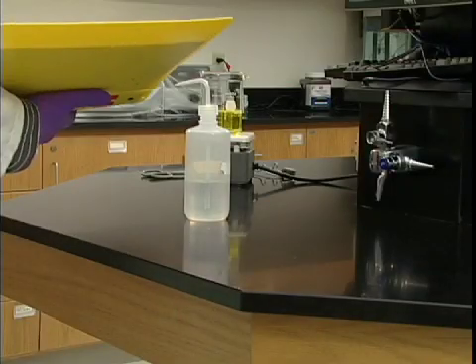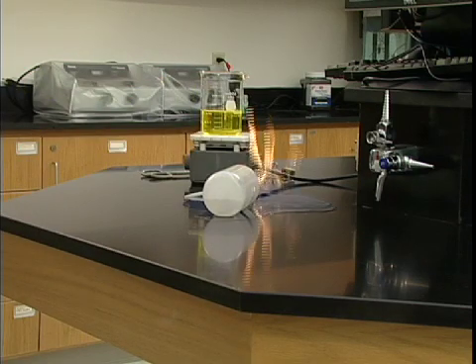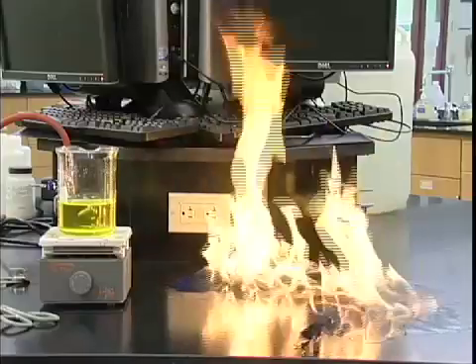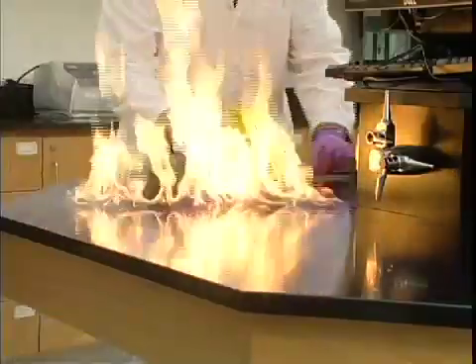Accidentally knock over a half liter of acetone cleaning solution. The liquid splatters onto a working hot plate. Instant fire. What do? You act quickly, relying on common sense and a thorough understanding of your lab's emergency plan. Step-by-step procedures you know inside and out.